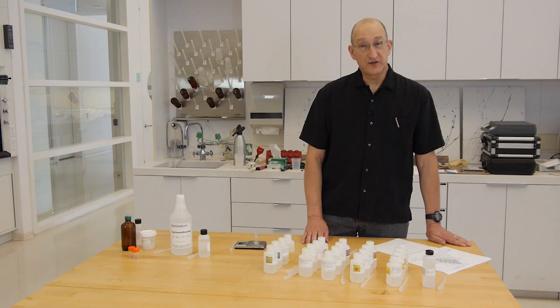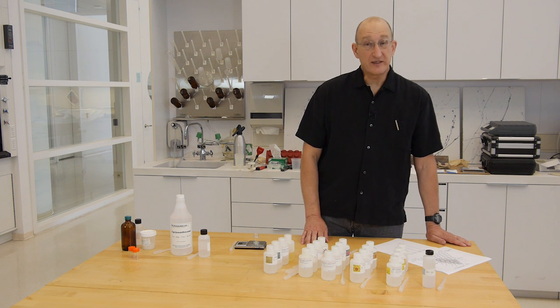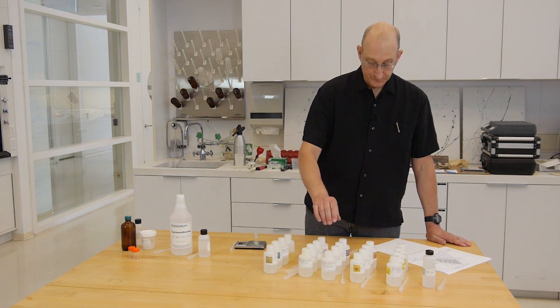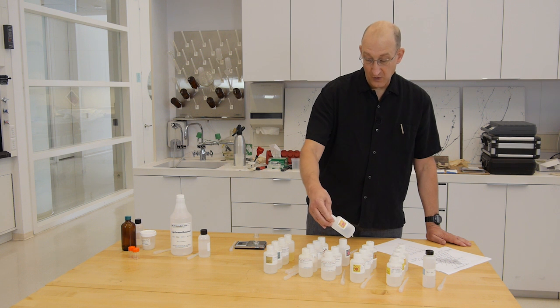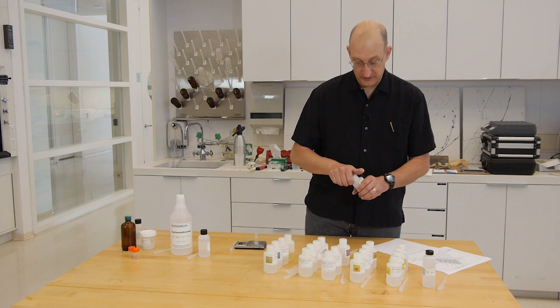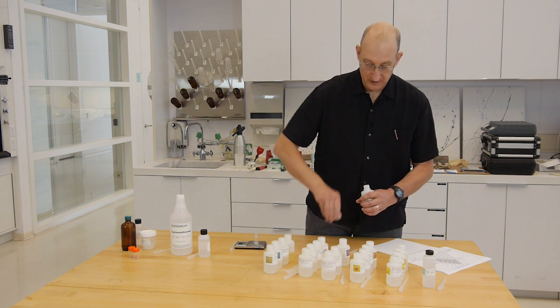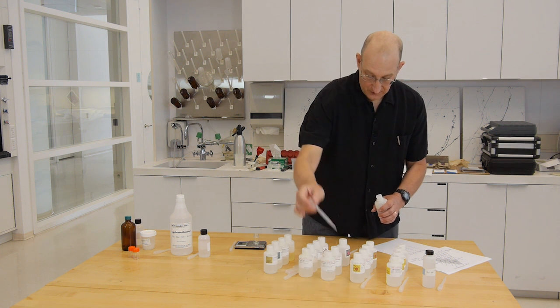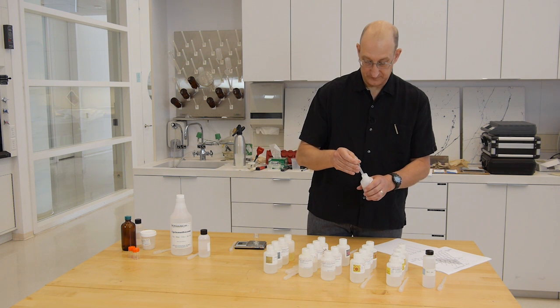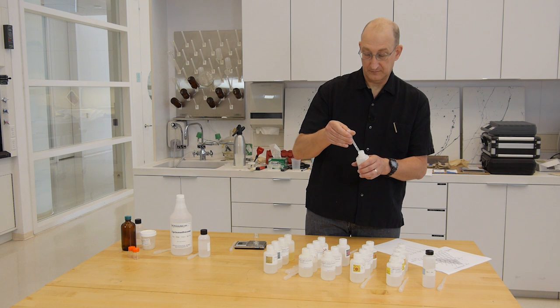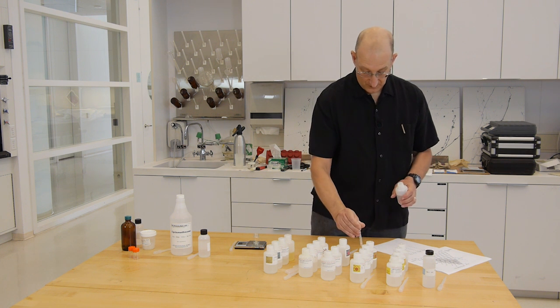We're going to do a 6.0 EDTA solution. So we're going to take 1 mil of the 6.0 EDTA and put it in our cup.